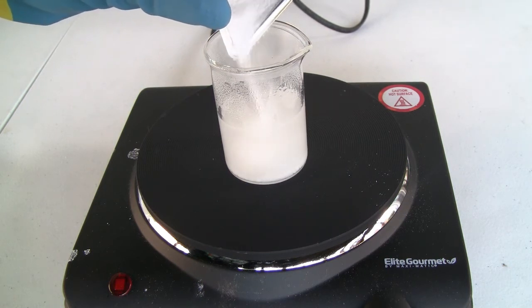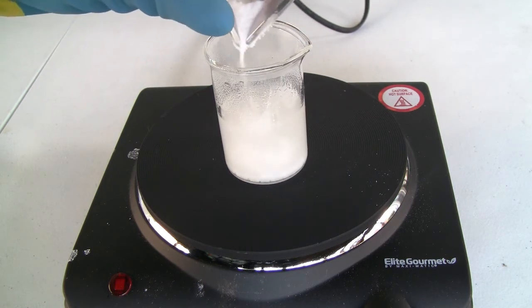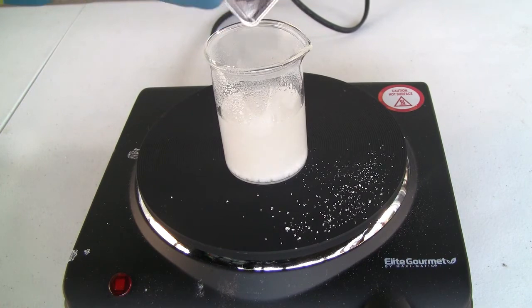The solution will still be a little cloudy, but that's okay. I spilled some borax here, which will most definitely lead to some lost yield.